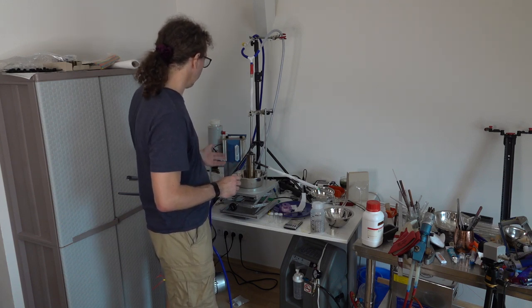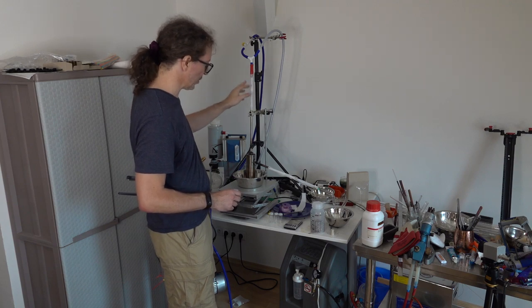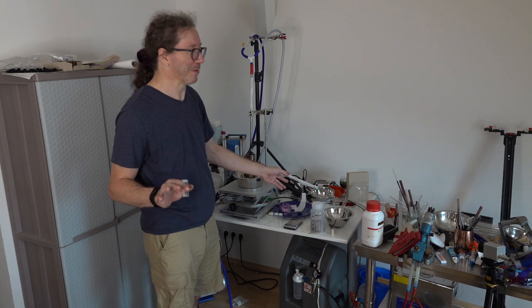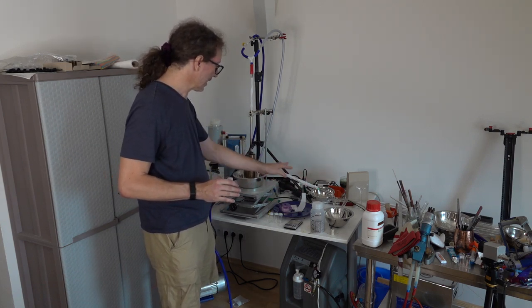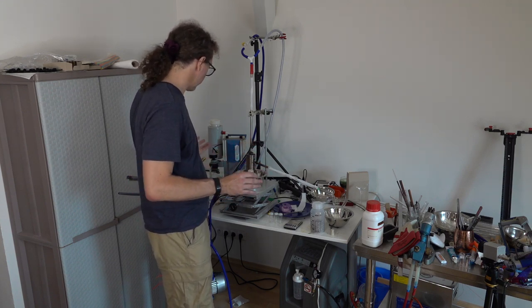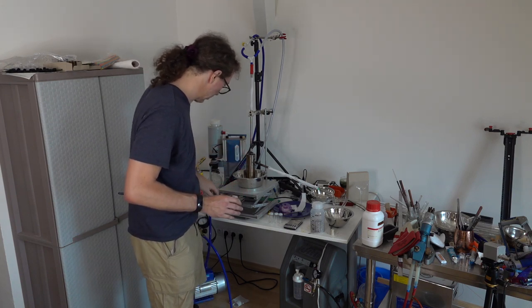So, I've got my vacuum up here. I've got my pieces of tissue paper, which I can spray with water. I'm going to keep that separate from the cesium, but that's going to keep everything cool. So in the first instance, I'm going to vac it down, then I'm going to fill it with argon.